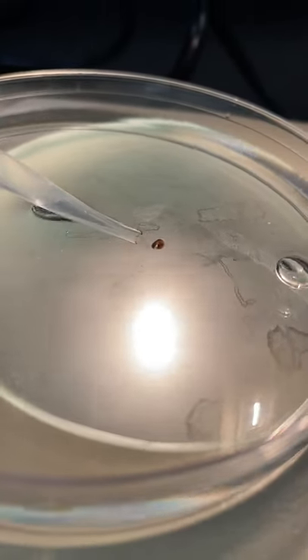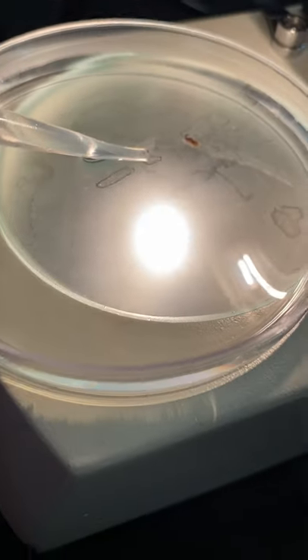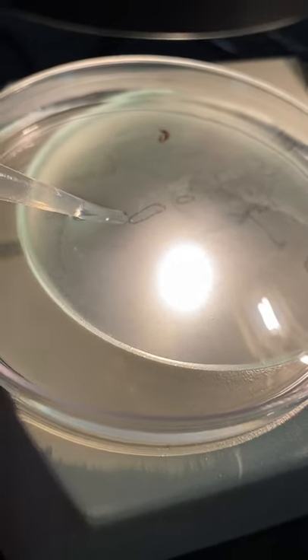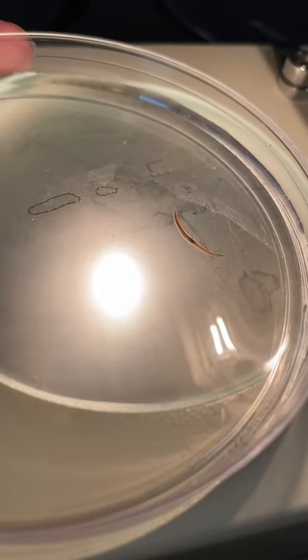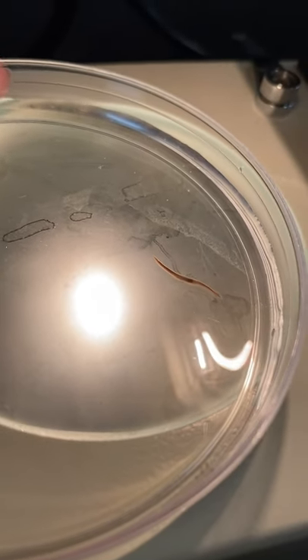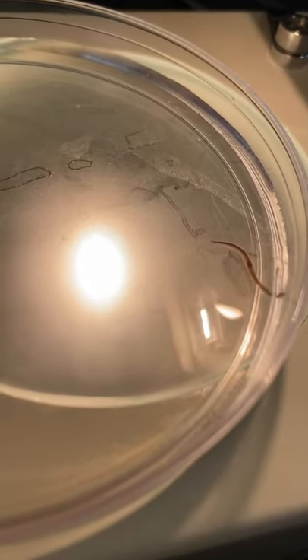This is a larger one — this is before they're cut, so let's create a water current and observe his behavior. That's where his pharynx is — that tube with the mouth is for feeding. Look how he moves. They also don't like the light, so they like to go towards the edge of the petri dish.